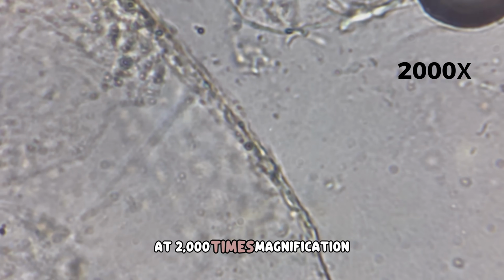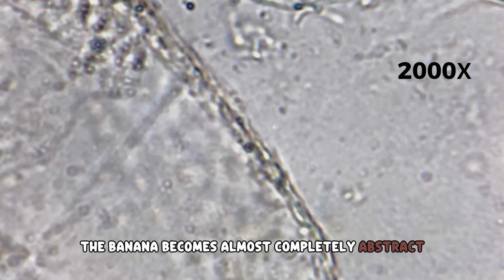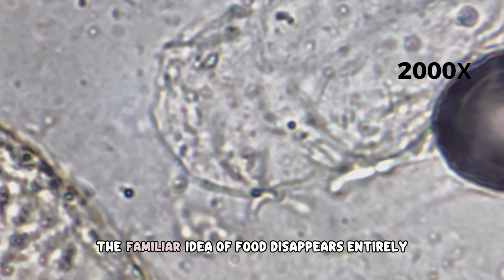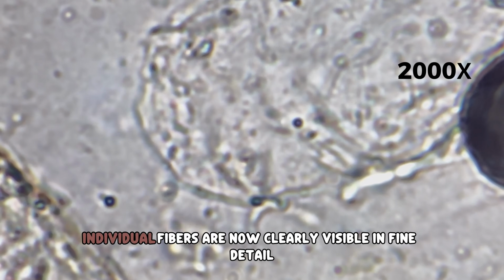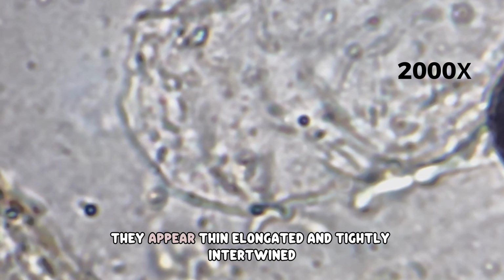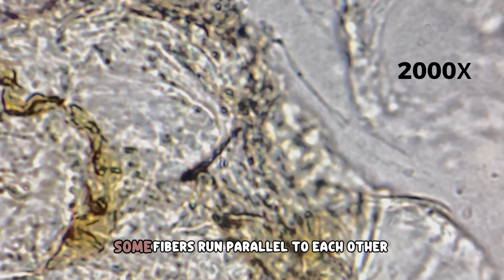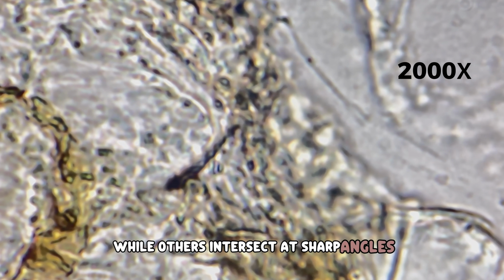At 2,000 times magnification, the banana becomes almost completely abstract. Nothing here resembles fruit anymore. The familiar idea of food disappears entirely. Individual fibers are now clearly visible in fine detail. They appear thin, elongated, and tightly intertwined. Some fibers run parallel to each other while others intersect at sharp angles.